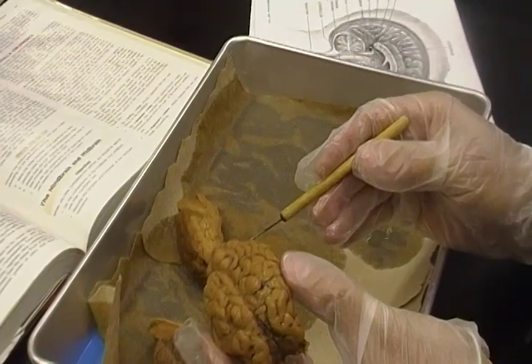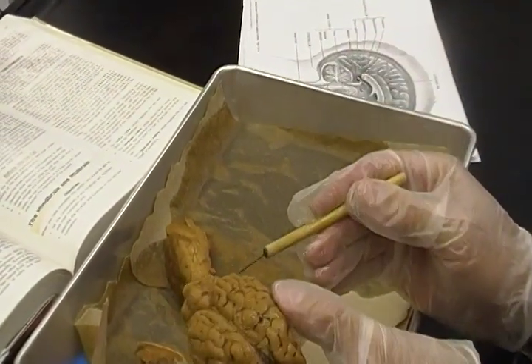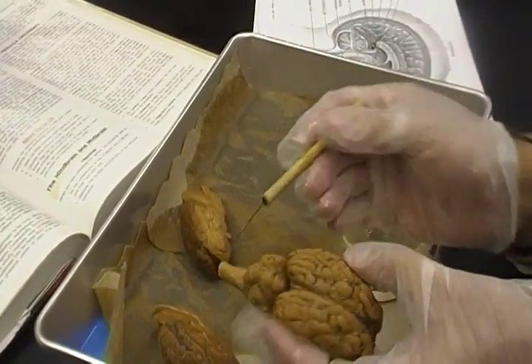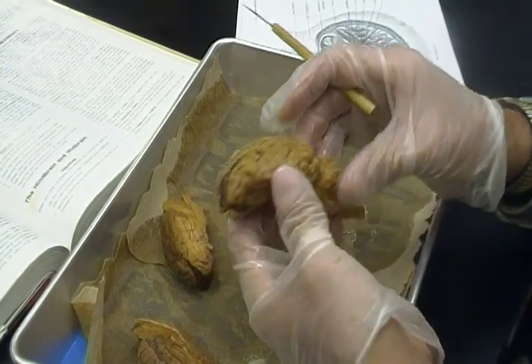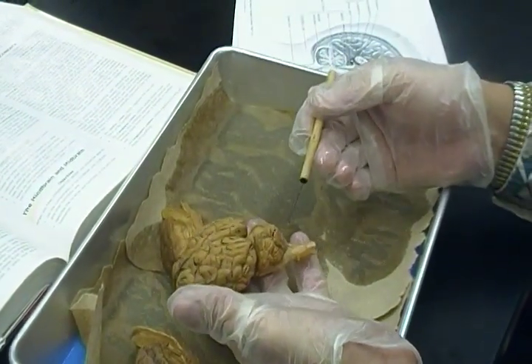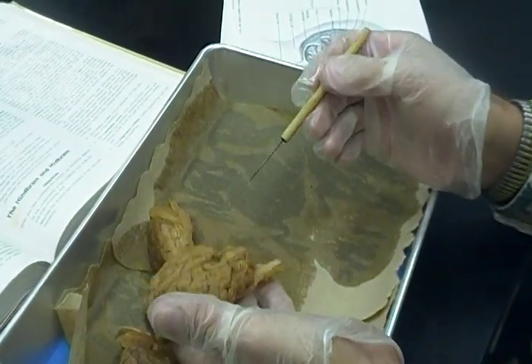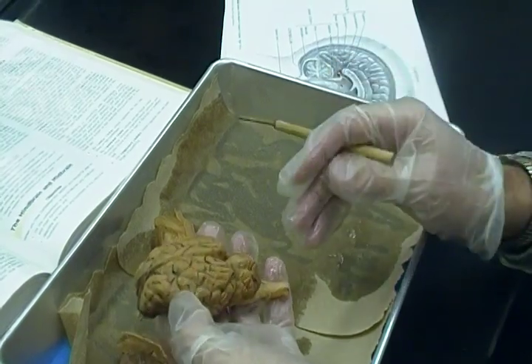What is this portion that goes down your vertebral column? That's the spinal cord. Well, the brainstem would end about here. That would be the medulla. It would end right about there. So that's pretty good. Okay, so I got my cerebral cortex, I got my longitudinal fissure, I got my cerebellum, I got the transverse fissure over here. Am I going too fast for you, Sam? No. And we got the spinal cord.